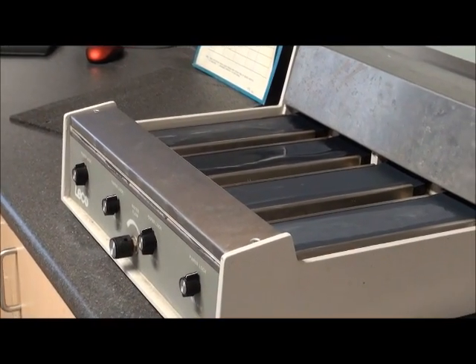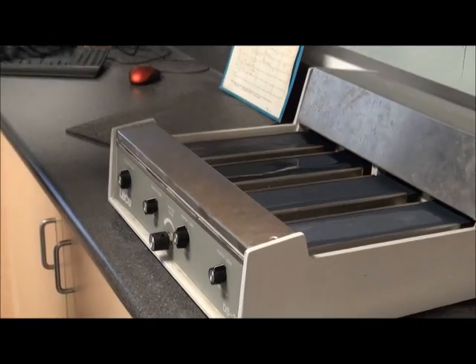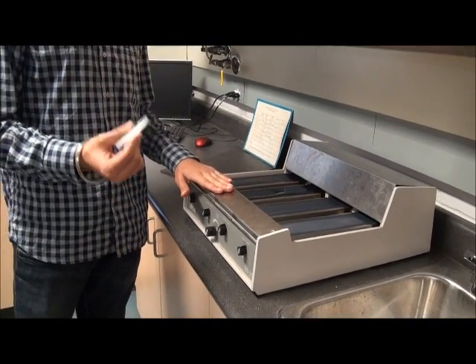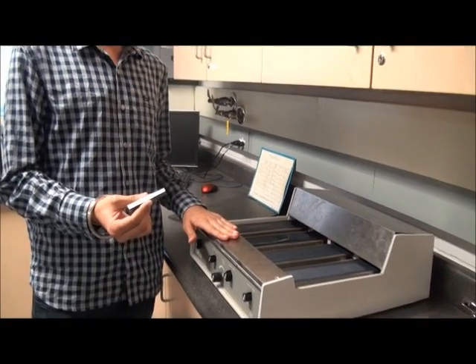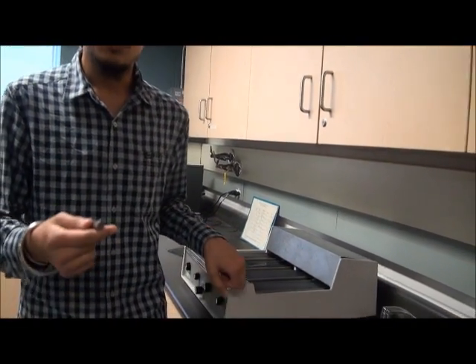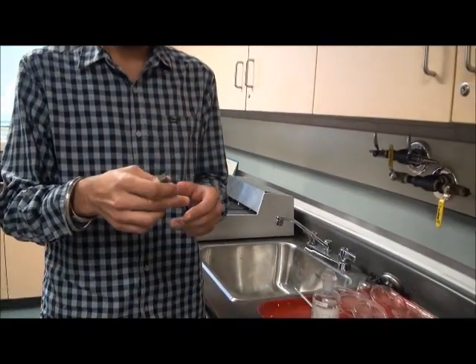After performing the hardness test, we are performing the grinding. We are supposed to do the grinding on a wet sand paper. After performing the grinding, which my friend will of course tell you how to do that, we are supposed to go for the polishing work.